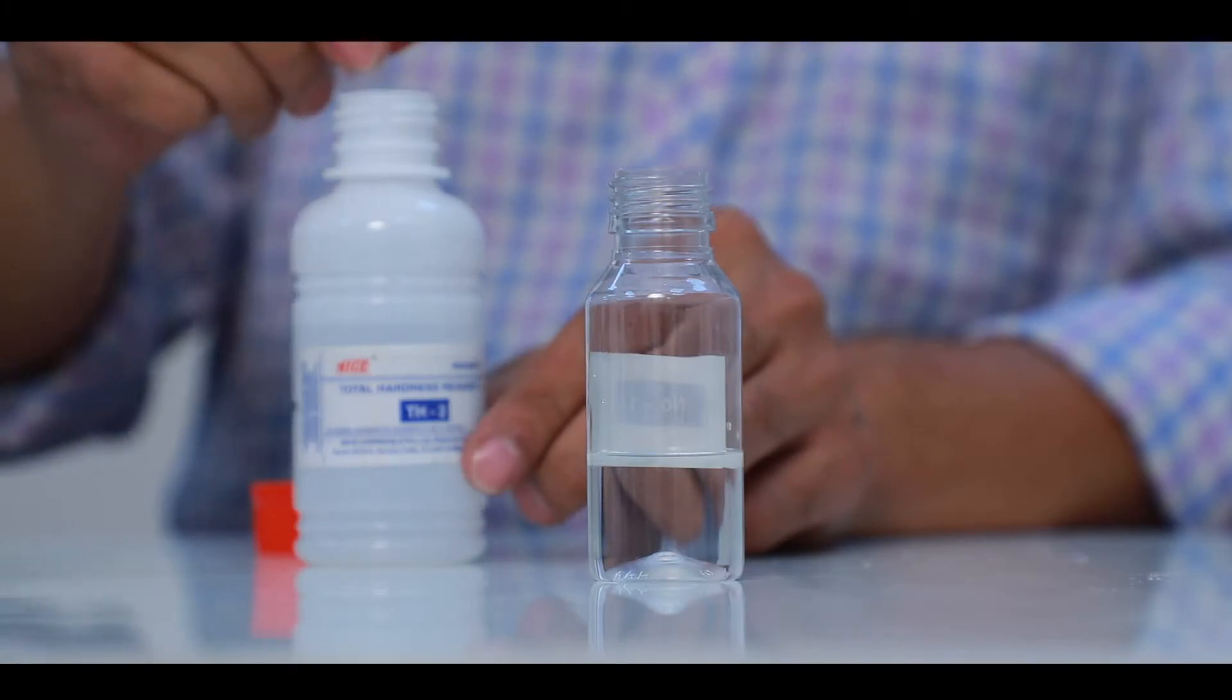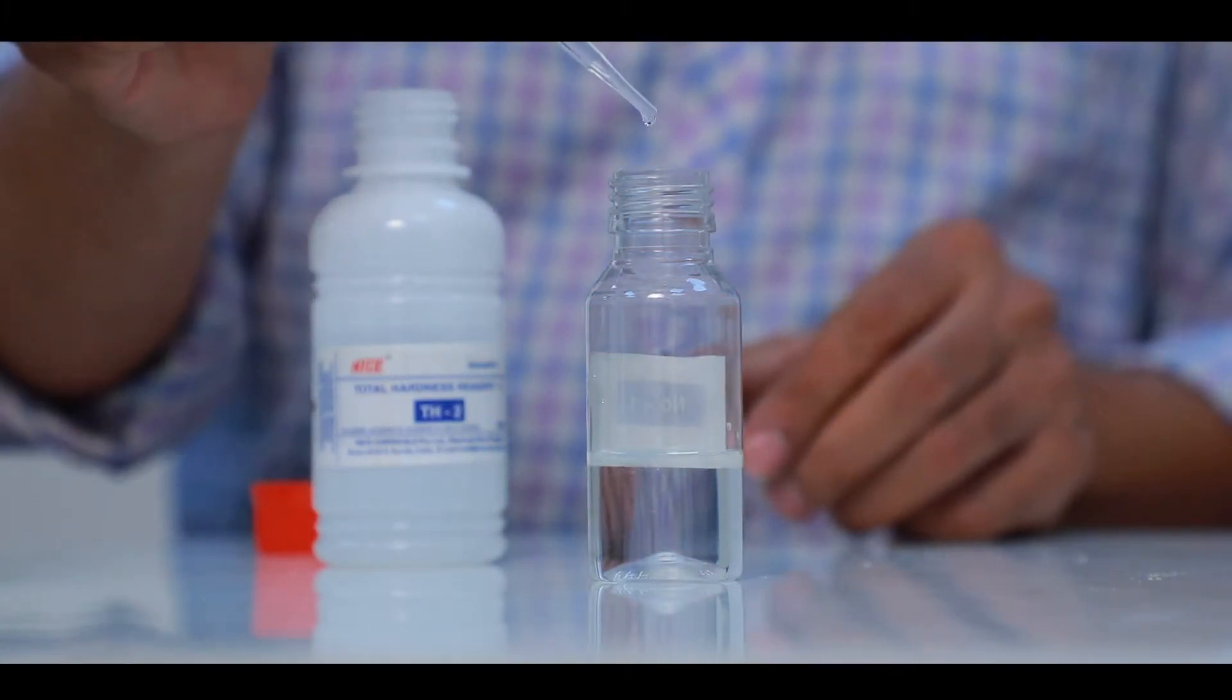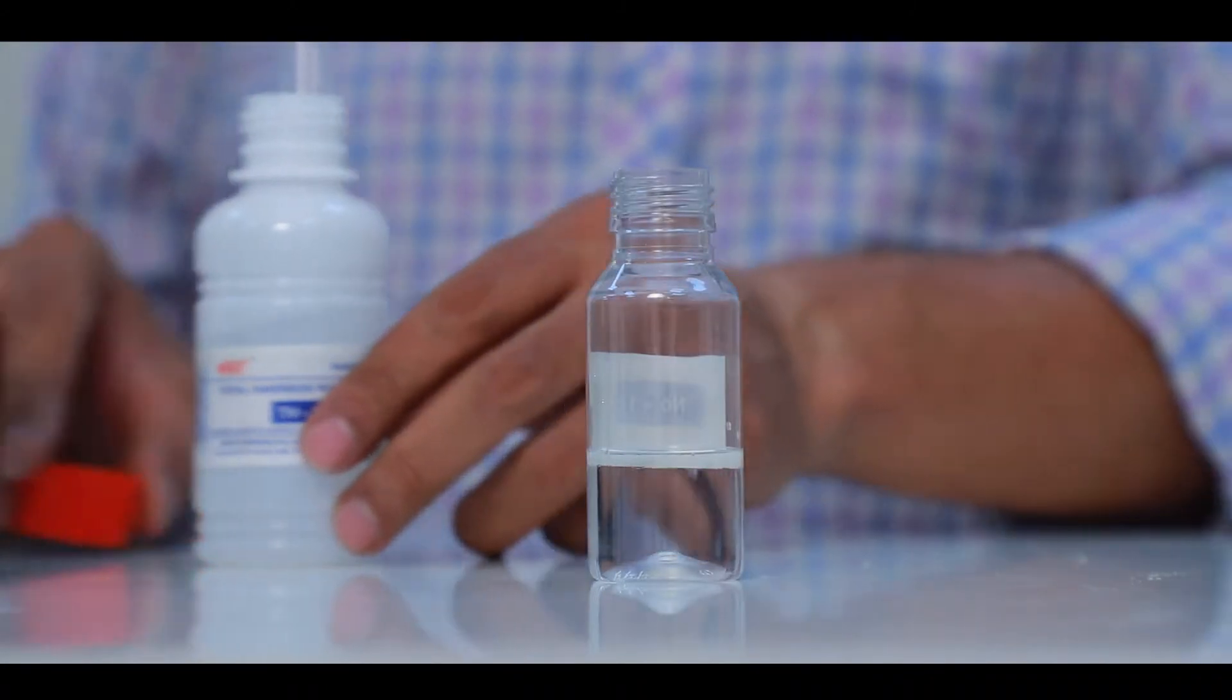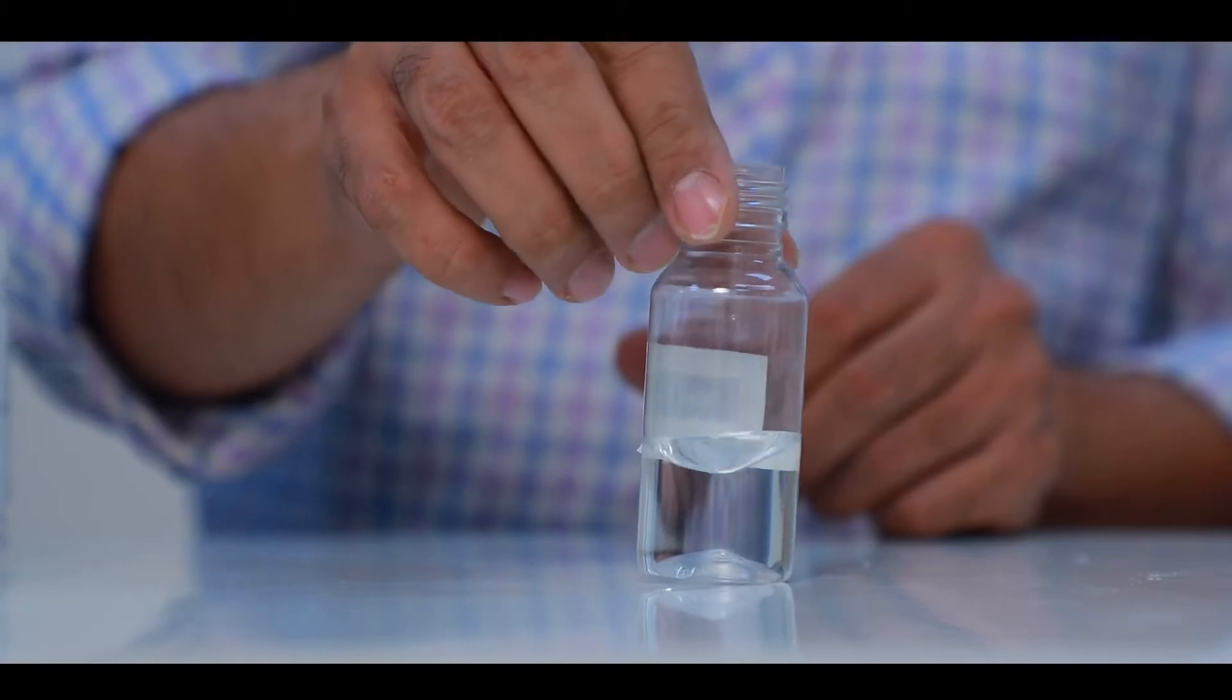Add 10 drops of Total Hardness Reagent 2. Add few specks of Total Hardness Reagent 1.